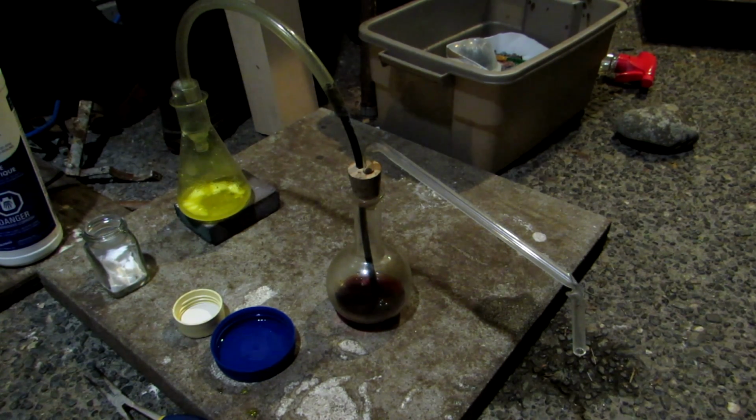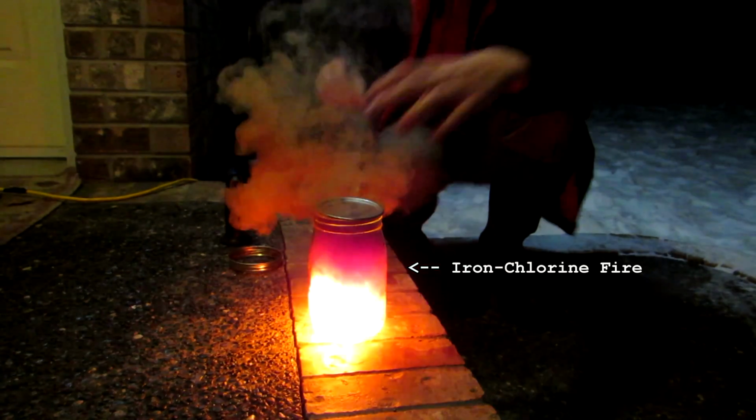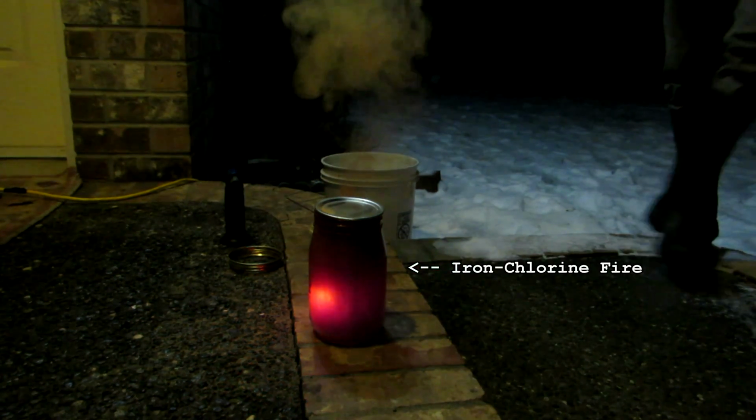When I was done extracting the iodine, I still had a nice flask of chlorine gas though, and I certainly didn't want to waste it. Although steel wool burns nicely in air, it also creates a neat iron chlorine fire with chlorine gas, so I thought this would be an appropriate way to use the extra chlorine gas.